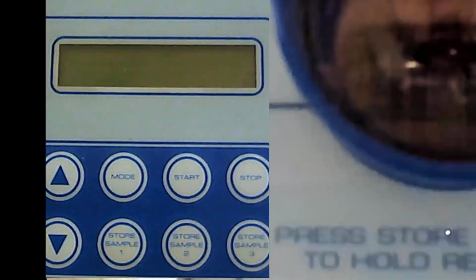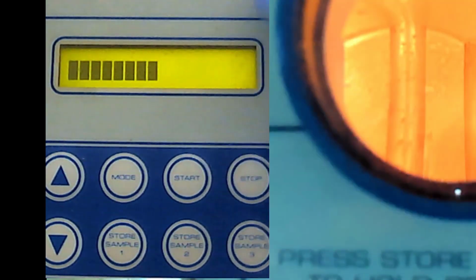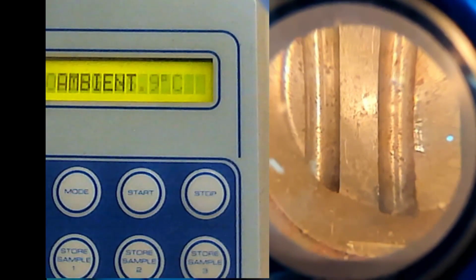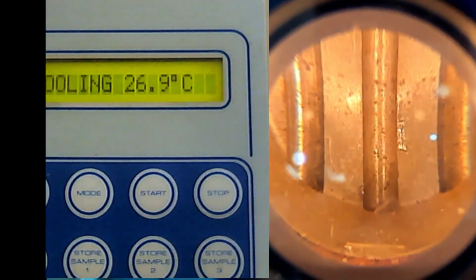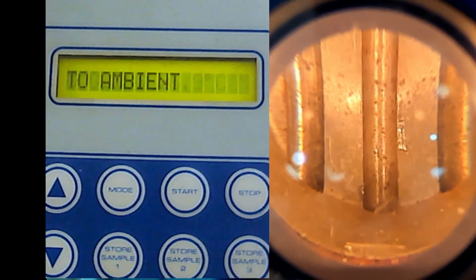So I will open here. I will open the machine so you can see. I hope you can see there. Because we will do three simultaneously, you need to see all three holes. Okay, so I think that's okay. This is not okay. Let's see here. Okay, the same machine but a different machine. Where is my sample? Here.